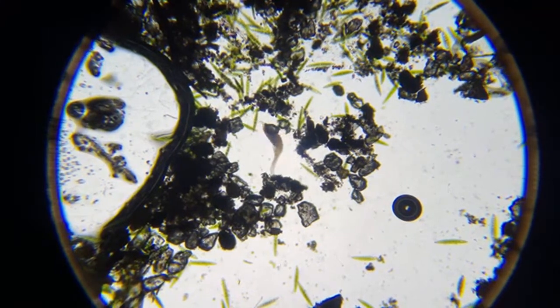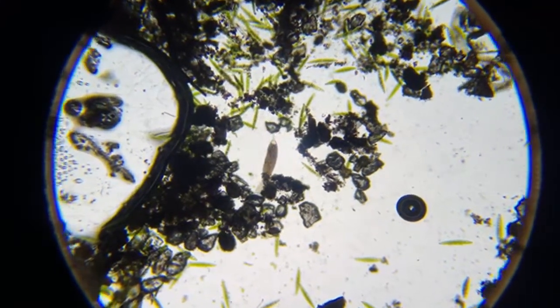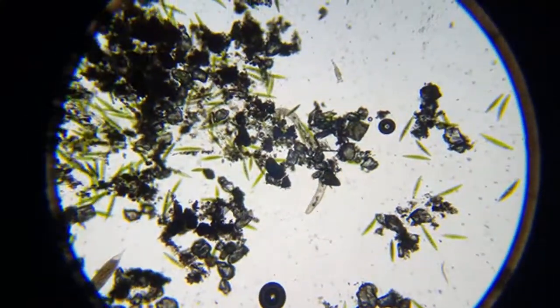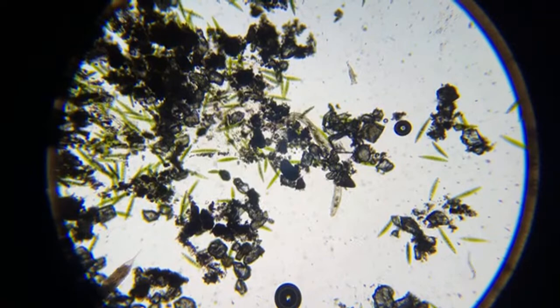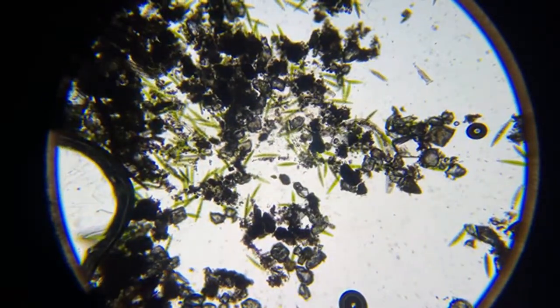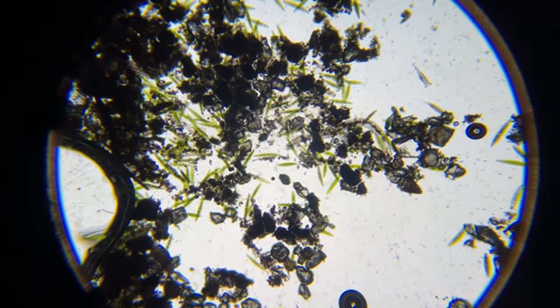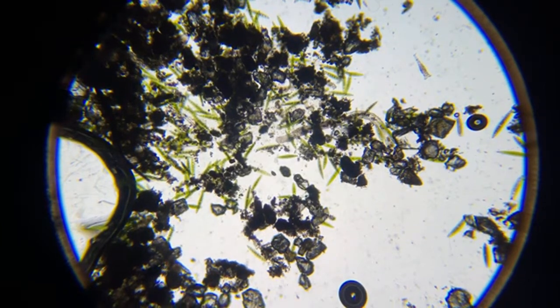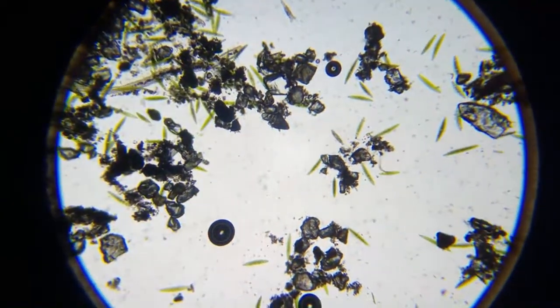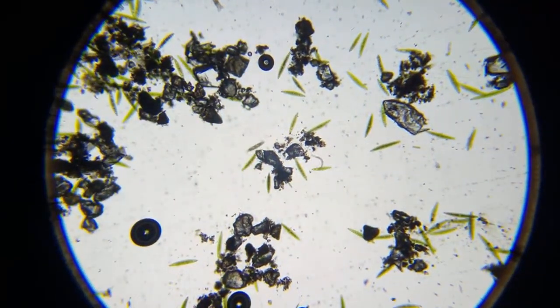Dileptus, he's a single-celled animal, well, a single-celled protist. This big guy over here moving with the flat head is an Aeolosoma, and he is a segmented worm, an annelid, sort of related to an earthworm. This guy wiggling right here, that is known as the dreaded hookworm.